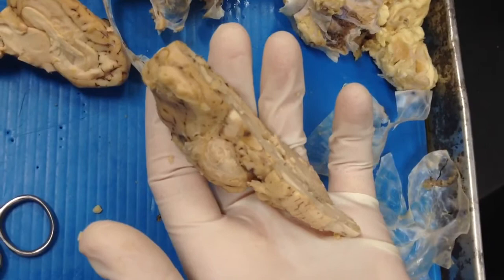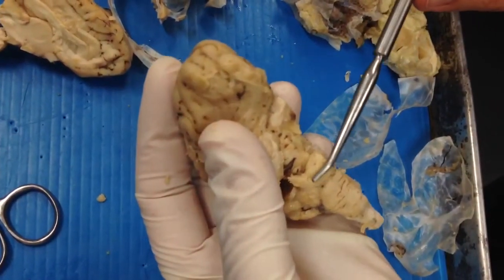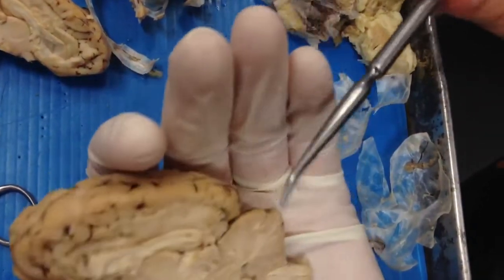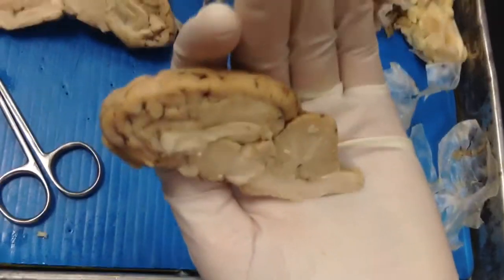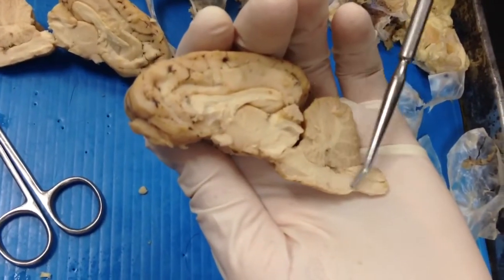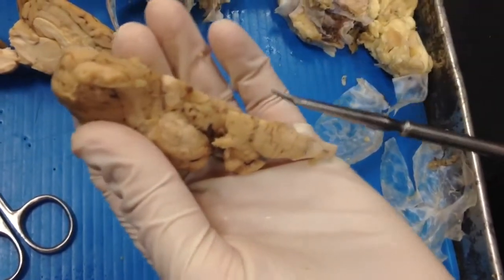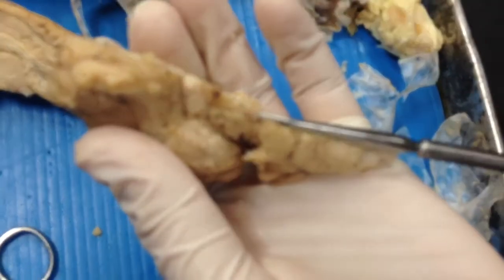And then we go to the pons. The pons is here. The cerebellar hemispheres — this is half of the cerebellum. The medulla oblongata. The basilar artery goes through the pons and the medulla oblongata.